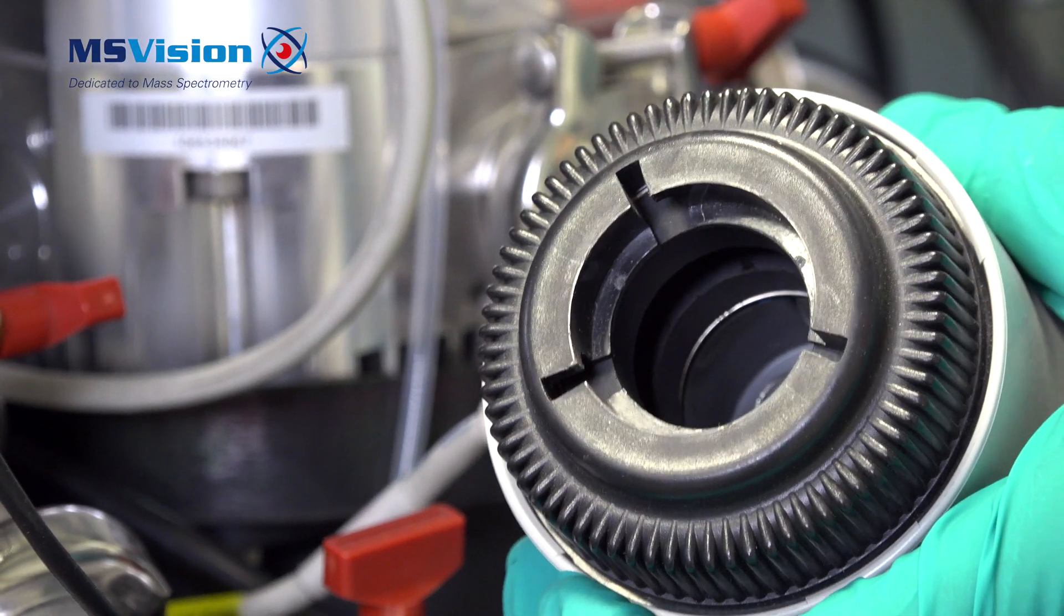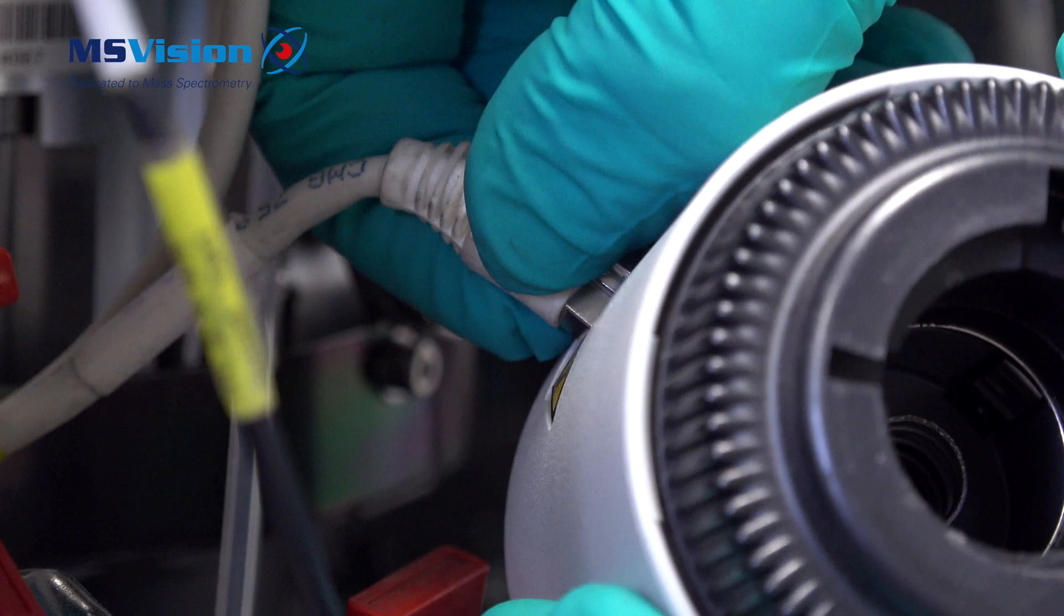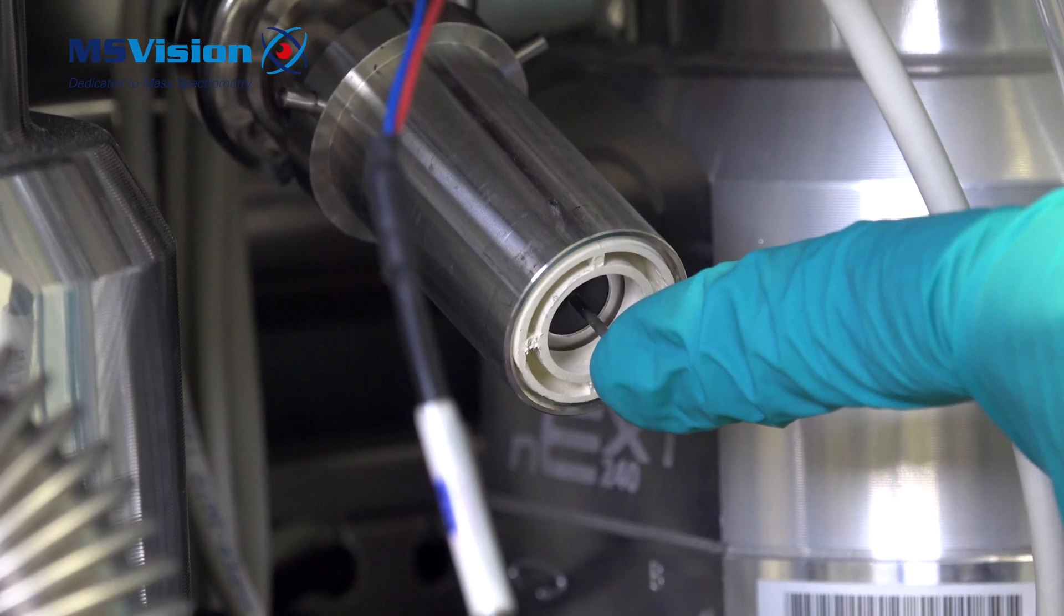This is magnetic. Remove the network cable. This is measuring the vacuum.